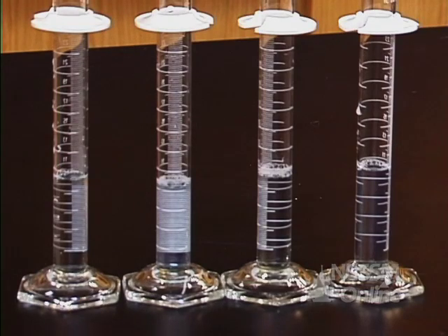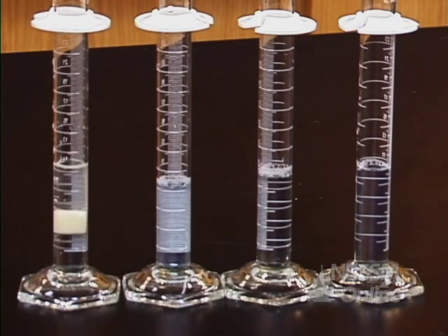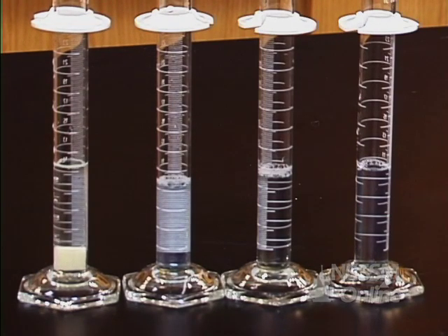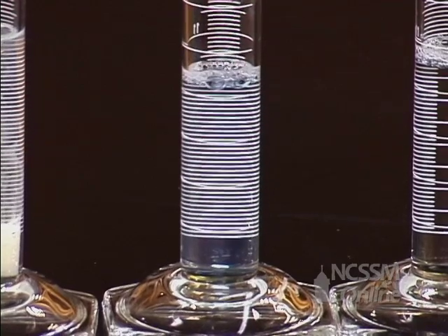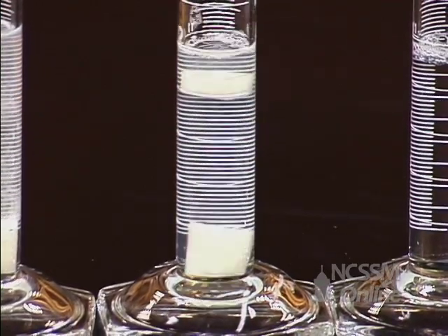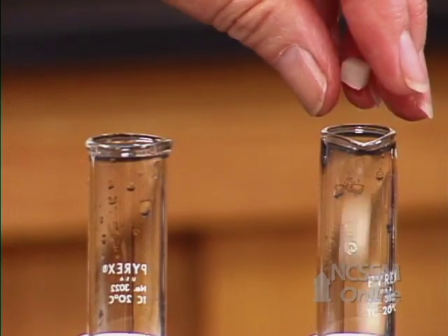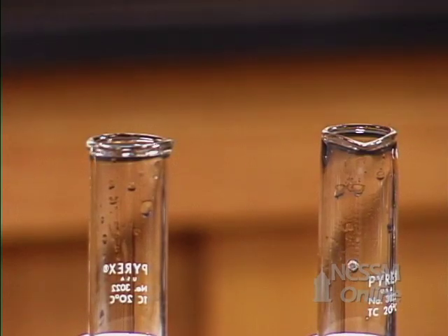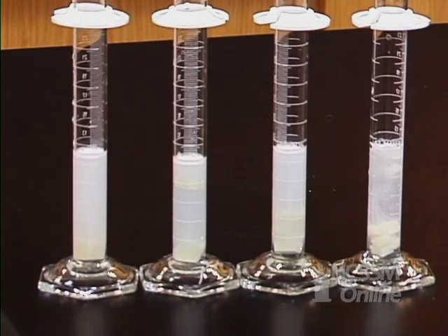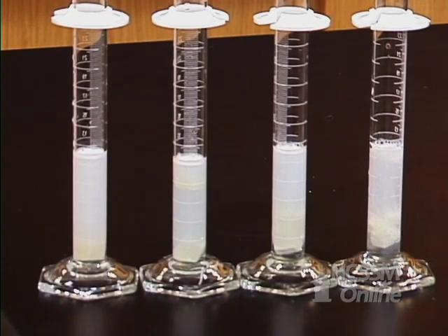I'm going to drop one in each of our graduated cylinders and we're going to time them. Since I can't do them all at one time I'm going to drop them in at ten second intervals. And then when we go back and collect our data we can add ten to these consecutively.